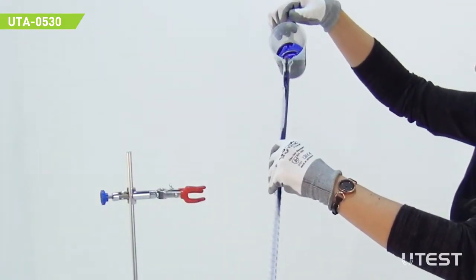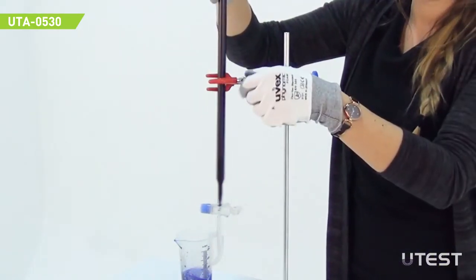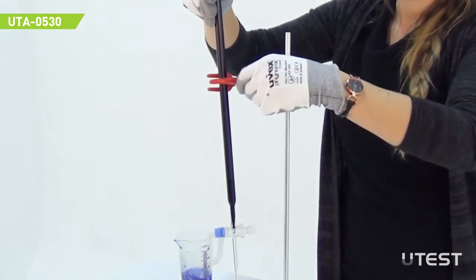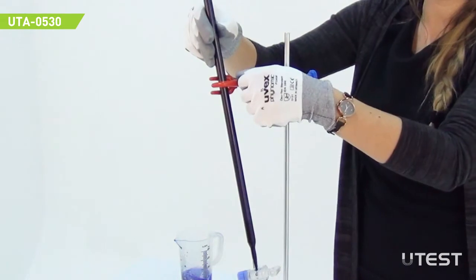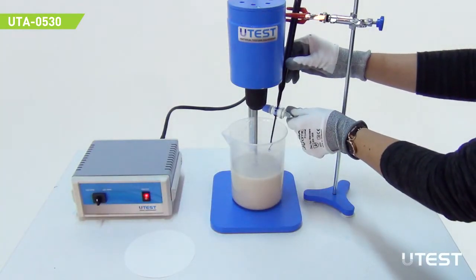Pour the methylene blue solution into the glass buret and fix it to the stand. Add 5 ml of dye solution.